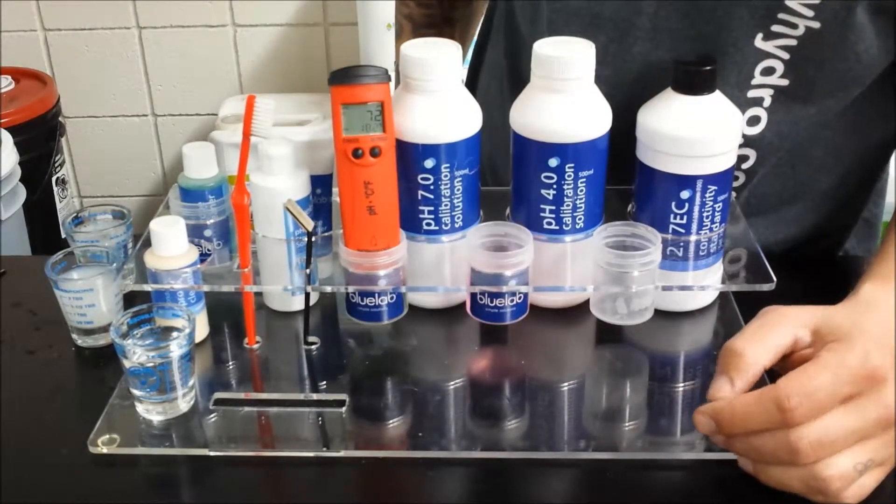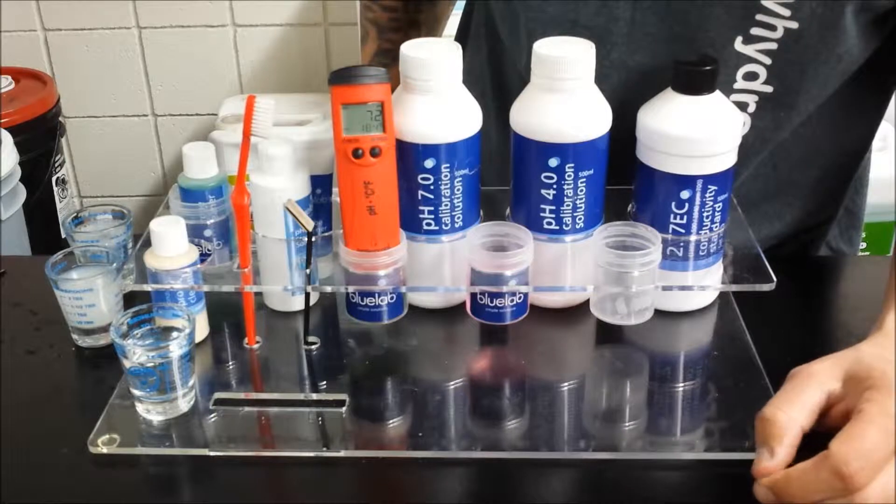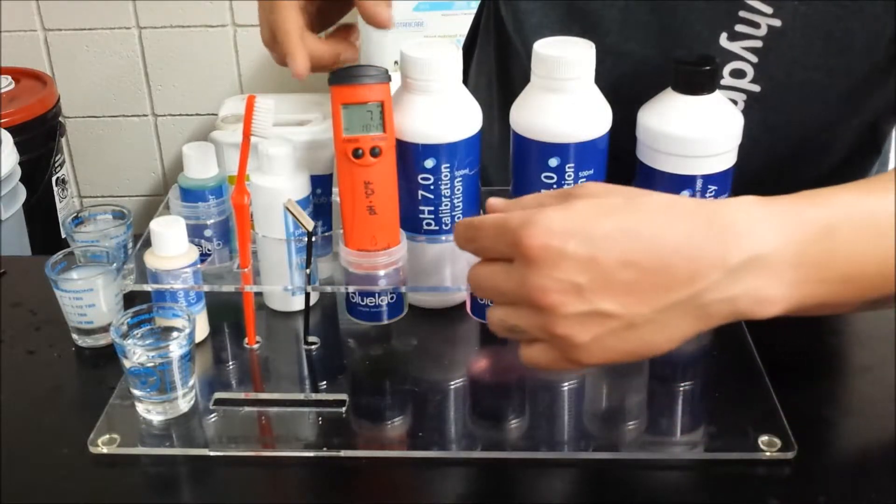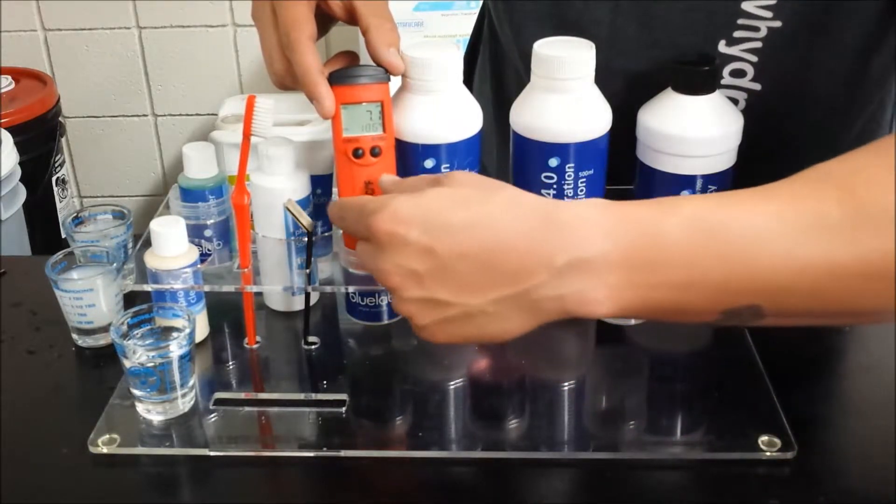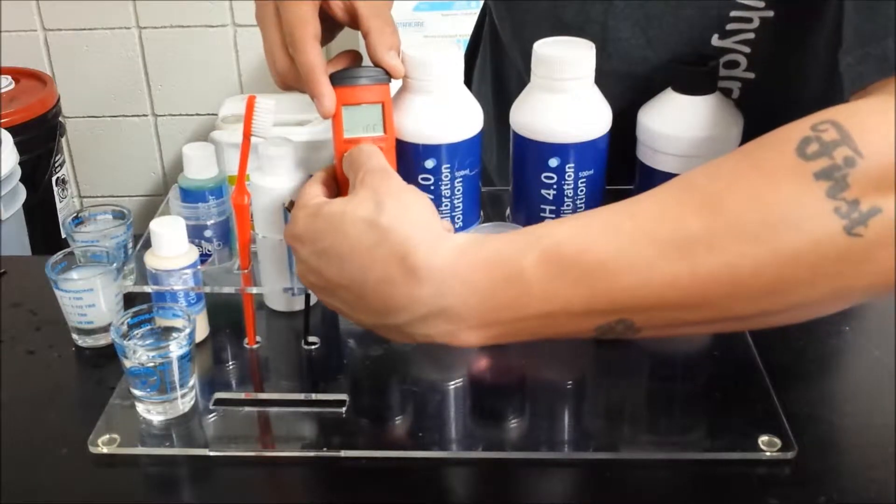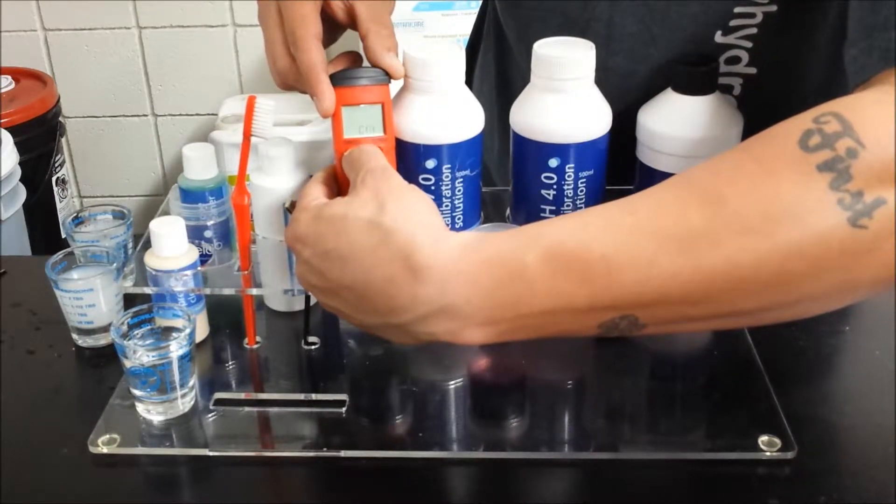You're going to want to put it in and let it settle on a number. Don't calibrate while it's still thinking. Once it settles, hold down the mode button until it says Cal.